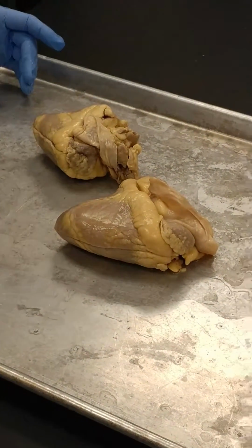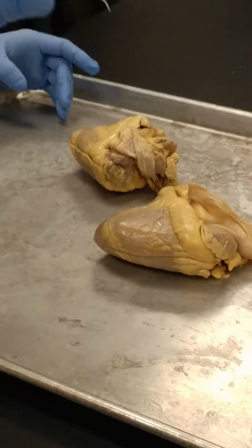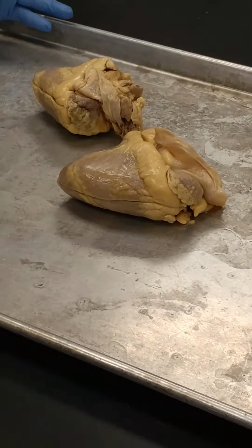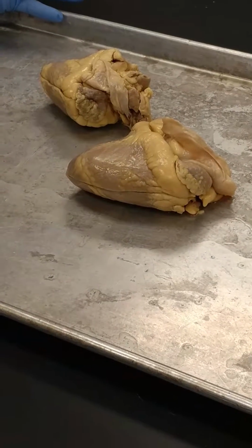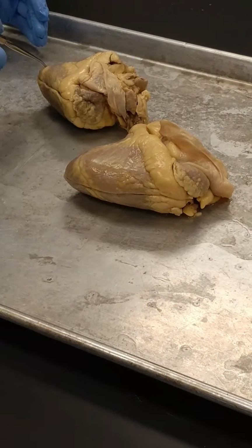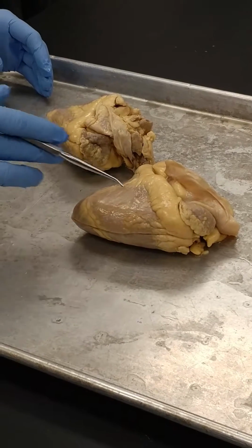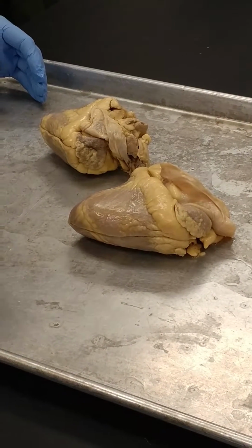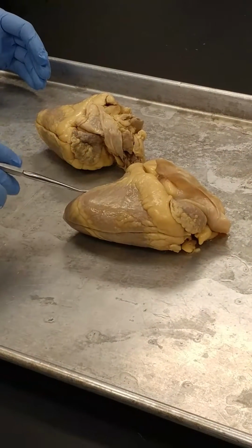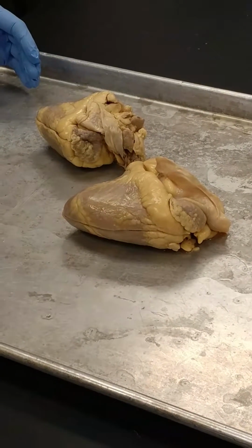The main reason why is, think about this. This is the only muscle in the human body that has to work all the time. This is truly your aerobic muscle. And if you're into working out, you know that the best way to burn fat is to do aerobic workouts, right? So fat needs to be accumulated in these areas because fat is the main energy source for the heart muscle tissue. We don't have a lot of glycogen here. Glycogen is found in the liver and in the muscles. When I say muscles, I mean skeletal muscles. We have a large fat supply here because that muscle is the epitome of an aerobic muscle.